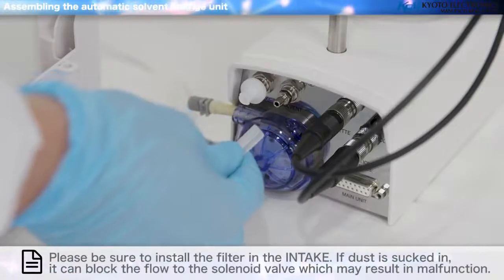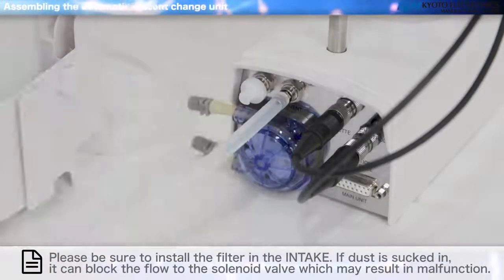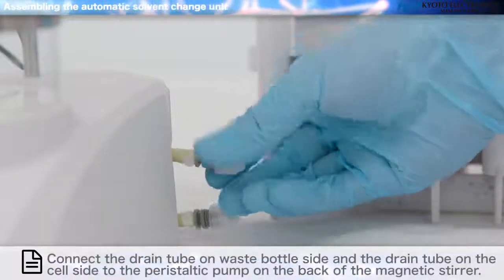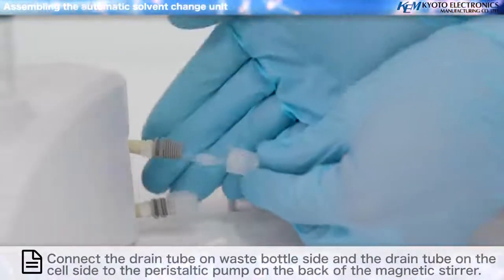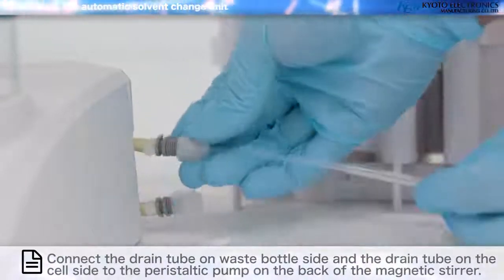Connect the connected silicone tube to solvent on the back of the magnetic stirrer. Connect the drain tube on the cell side and the injection tube to the plug for the cell. Connect the drain tube on the waste bottle side and the drain tube on the cell side to the peristaltic pump on the back of the magnetic stirrer.